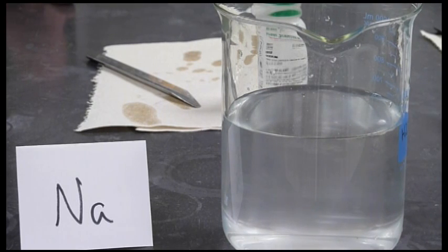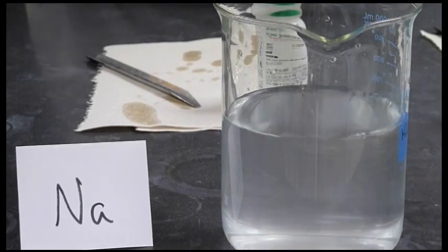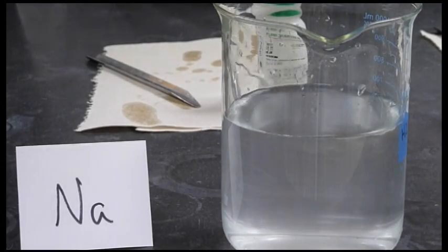You can even hear how much more reactive the sodium is. And as you may have noticed, it moves more quickly on the surface of the water. That increased motion indicates a more rapid generation of hydrogen gas. And there it goes.